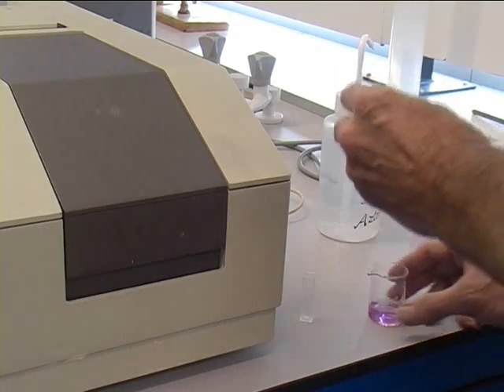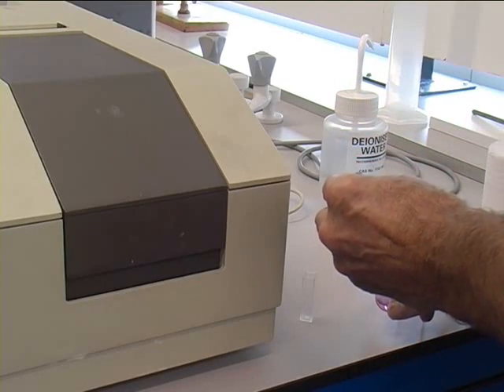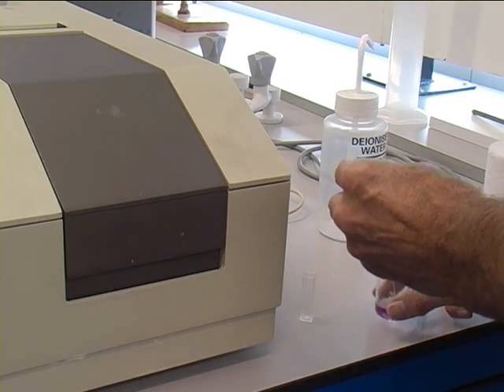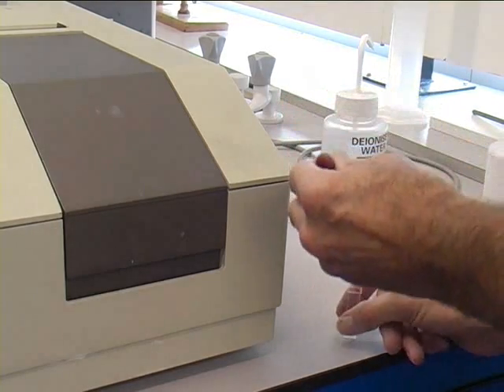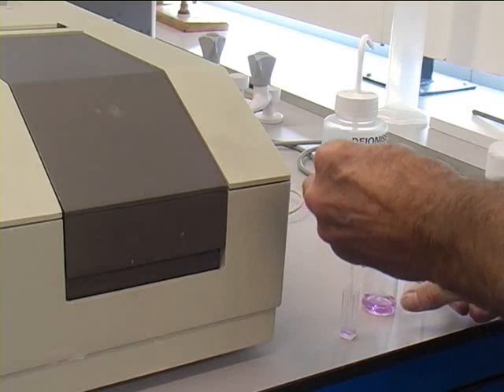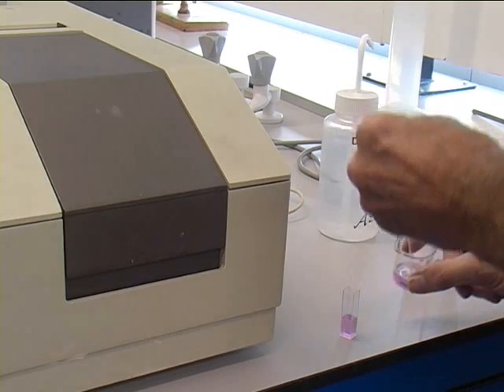Then, using a pipette, transfer your sample into the cuvette, leaving about one centimeter until the top. It is important not to overfill it.